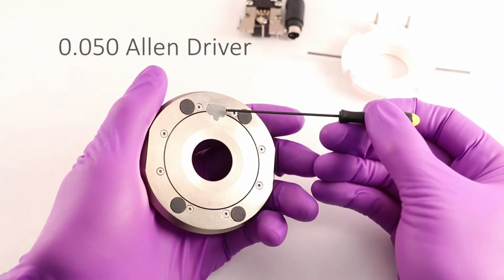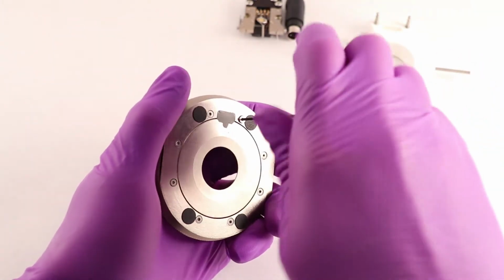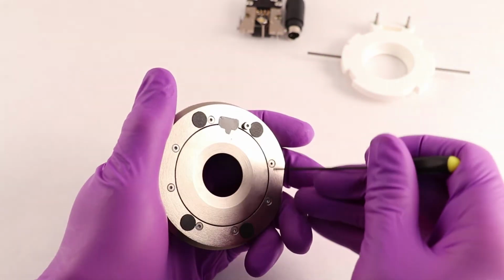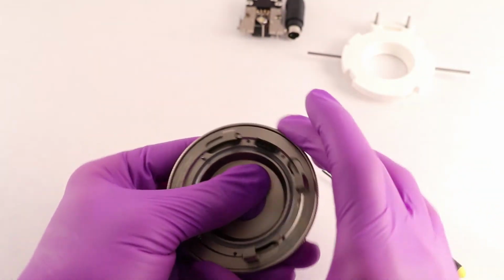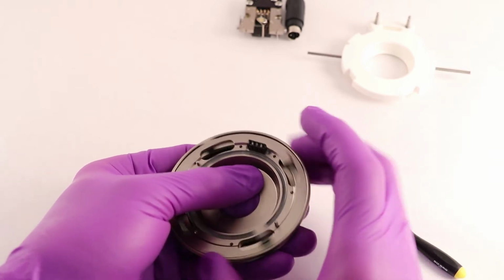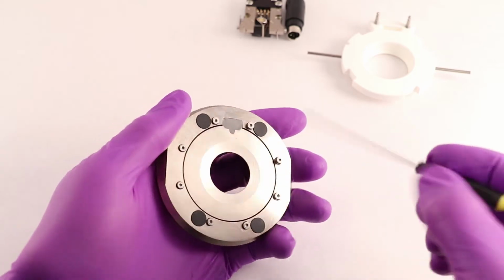To release the chamber, first use an 050 Allen driver. The screws are on the bottom of the chamber base. Loosen each screw so that it protrudes past the base of the dovetail. Once all screws are loose, try to normally tighten or loosen the chamber with the knurled ring. If at this point you cannot free the chamber, you must remove the screws fully from the chamber.